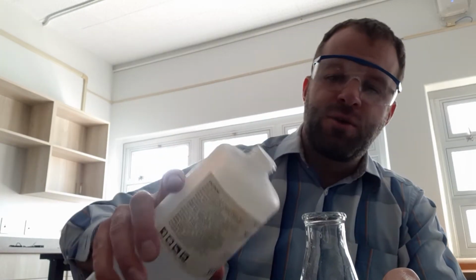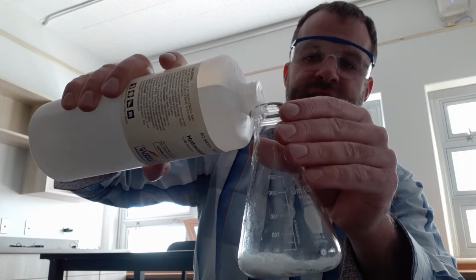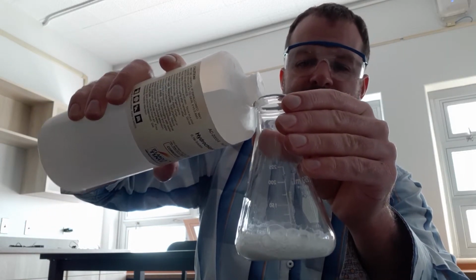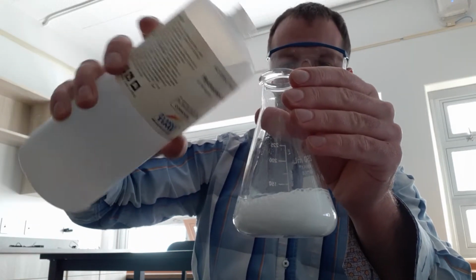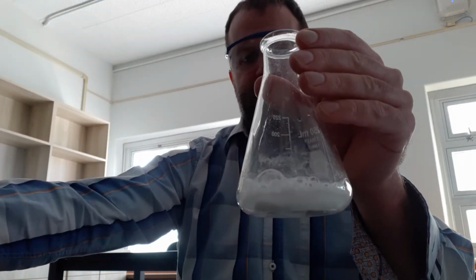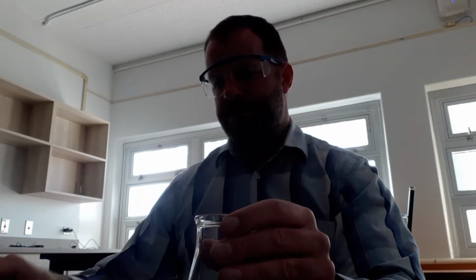Okay? So our first reaction, we're going to pour our acidic solution onto the baking soda. And just like we know and love, we see all that carbon dioxide produced, bubbles up. Okay? Now what I'm going to do is a little flame test to see what molecule is present within our flask.